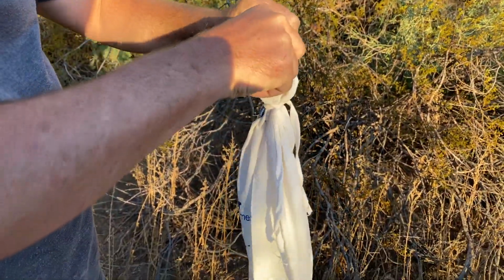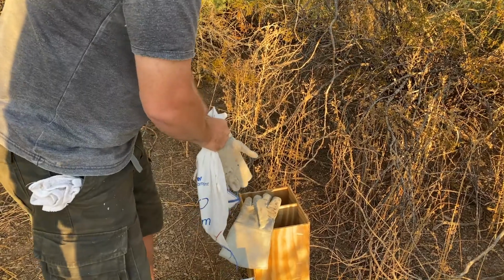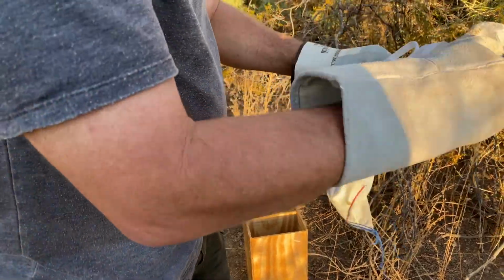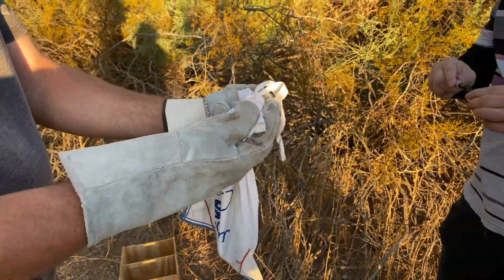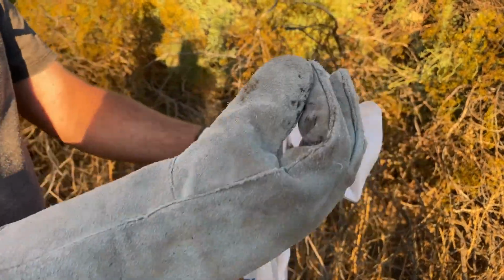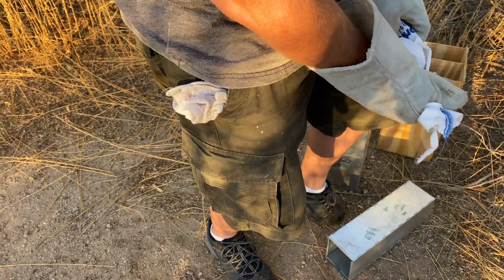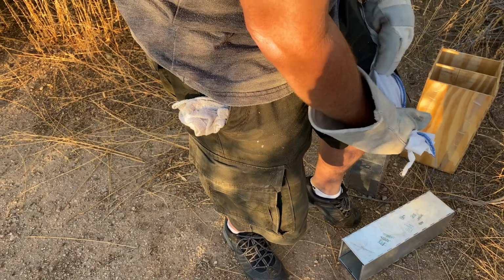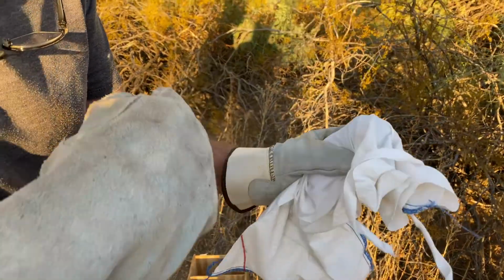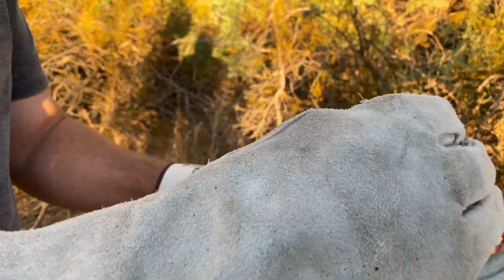So now we're going to mark the animal. Going to give it a very stylish tattoo. Envy of all pack rats. All right, Joey, so if you can undo the knot. That's it. All right, now sometimes they get out, they escape before we manage to mark them. I don't want it to escape, but sometimes they just do. All right, so coming close. Right, there we go. And I want to give it a little Sharpie mark in the ear.